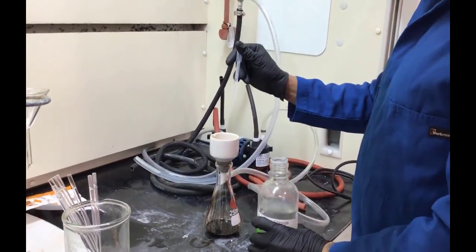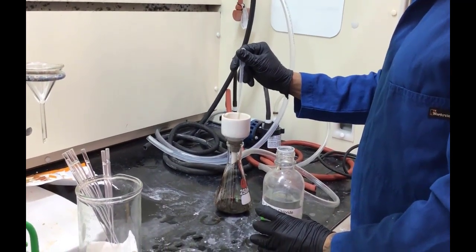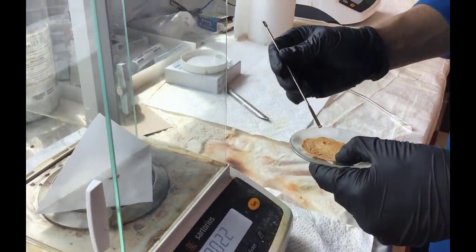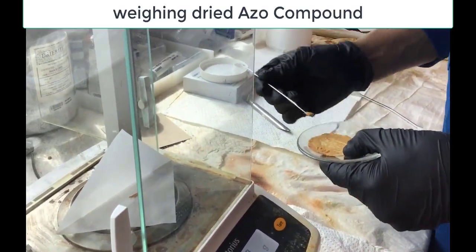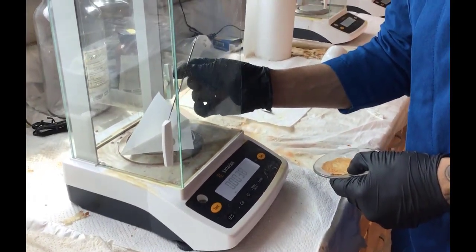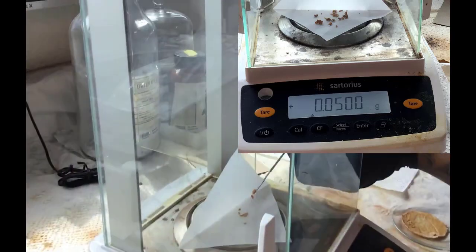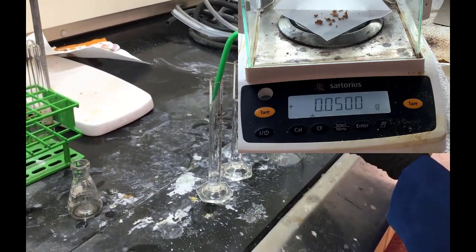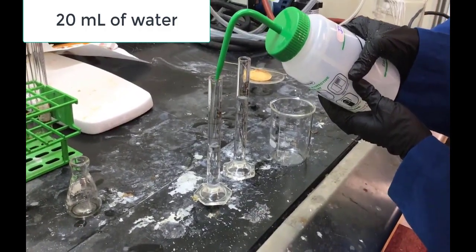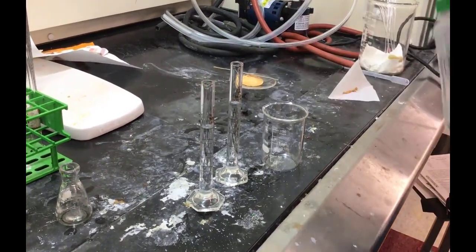Right, and then from there they left it on the Buchner funnel with the vacuum pump running to help dry it off. And so once it was fully dry, we now see them weighing out approximately 50 milligrams of the azo dye. All right, so not approximately, exactly 0.05 grams is 50 milligrams. Now we also see them measuring out in two 10 milliliter graduated cylinders 20 milliliters of water. So they're going to dissolve that azo compound in the water.